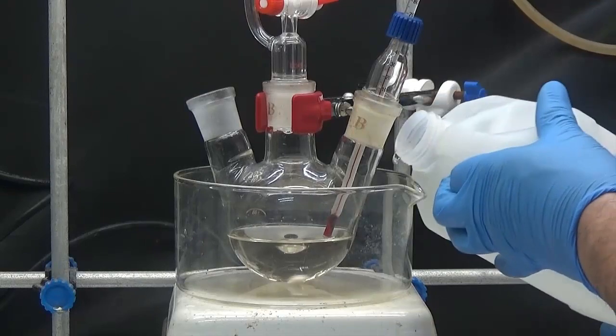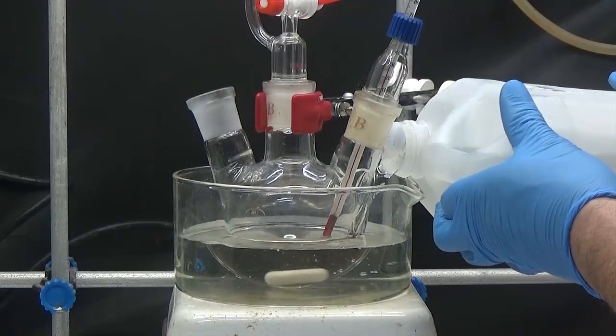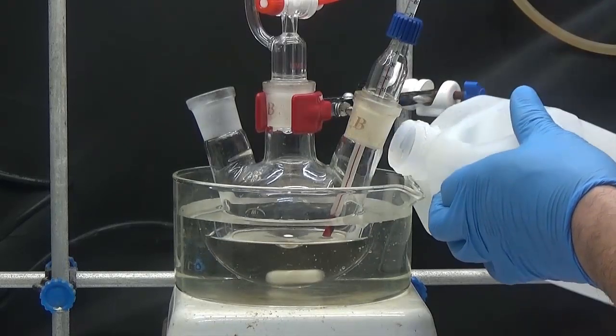We cool the sulfuric acid within a cool bath. I use a solution of 75% propylene glycol in water, chilled in the freezer.